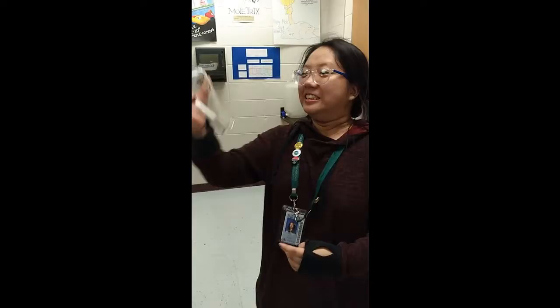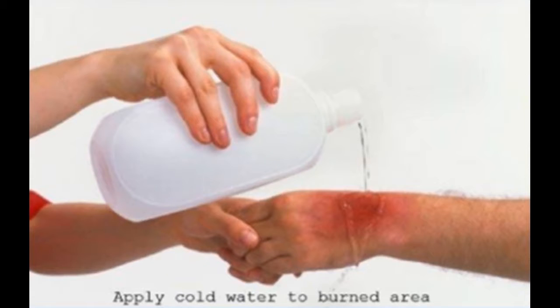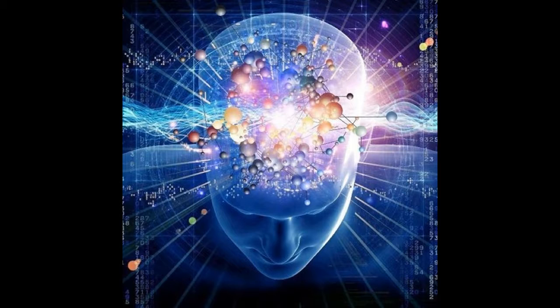In conclusion, our errors were that we did not let the flask cool enough, so we had to do a third trial. For the third trial, we tried to dry a wet flask by waving it around. Then we heated the water off it and started waving it around again. At this point, Big Brain Tollett advised us to cool the flask by pouring water on the outside. By adding this tip to the procedure, you would get done faster, unlike us who are micro-brained.